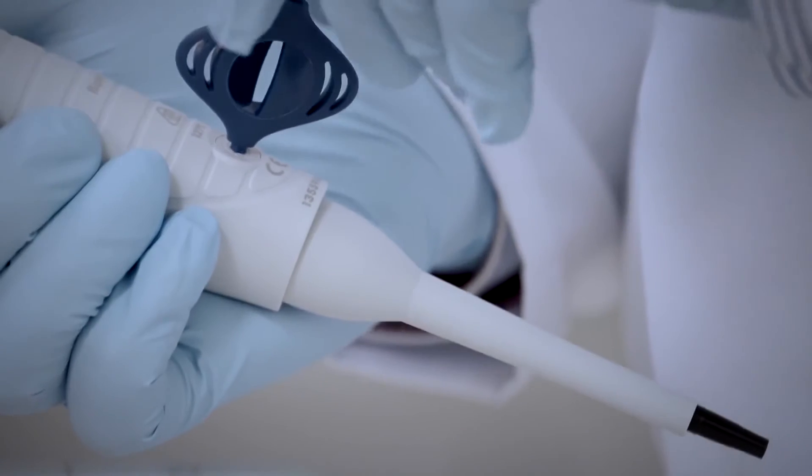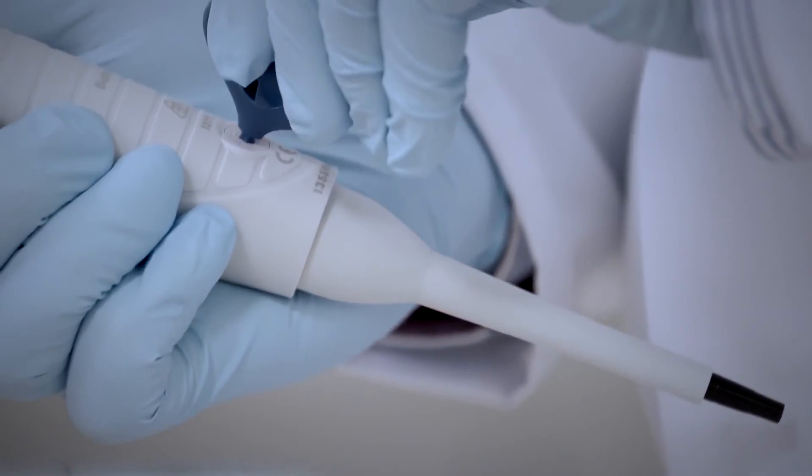If the pipette cannot be adjusted enough to correct accuracy errors, then the pipette must be checked for leakage or mechanical faults.